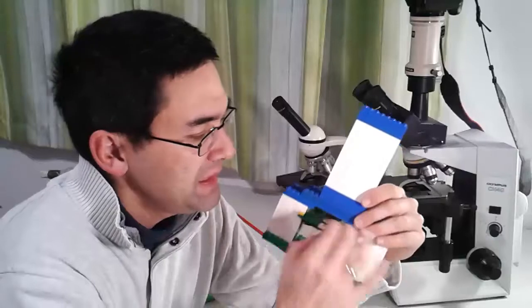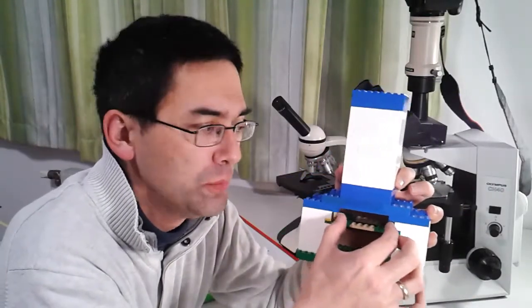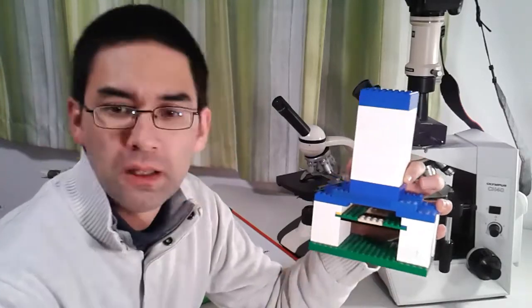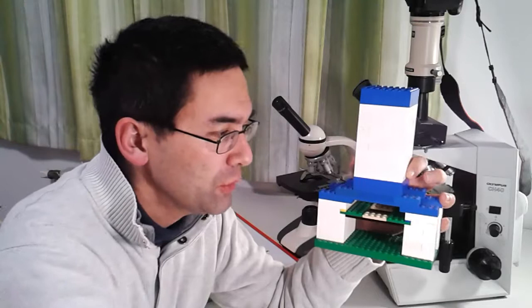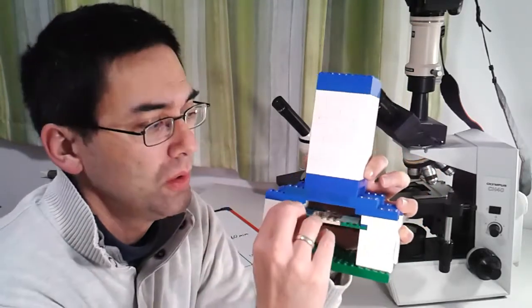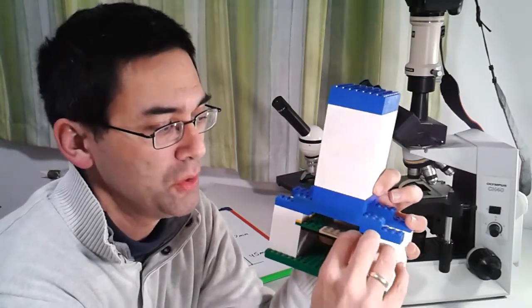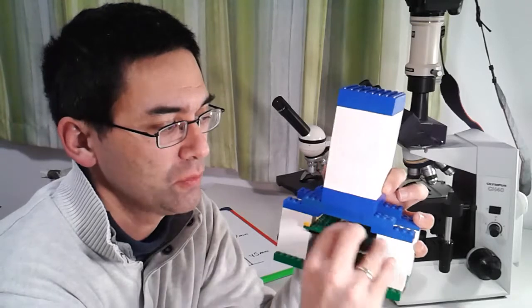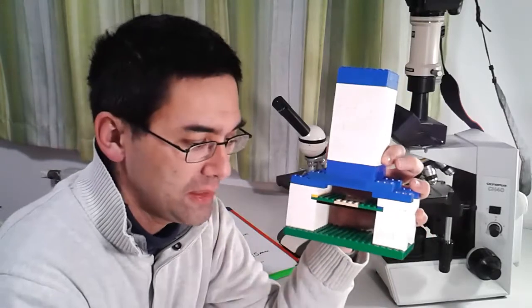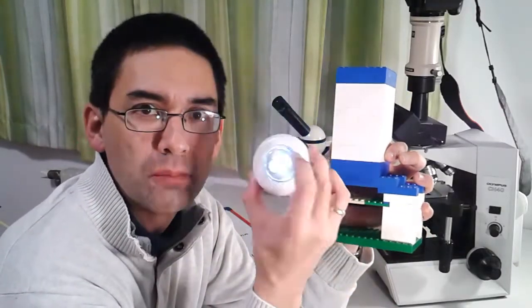It is not really wide enough to allow the slide to be moved to the side. So I'm putting in the slide differently — there's not a lot of space here. I'm putting in the slide like this, and then you can move it around in all possible directions — left and right and then like this. So what about the light source? I'm just using this type of lamp. I just put it in here and that's fine.